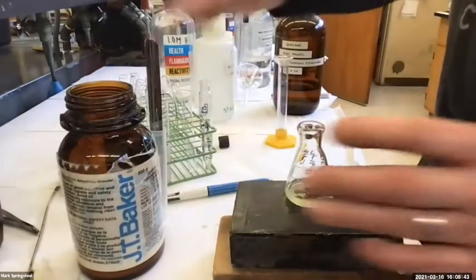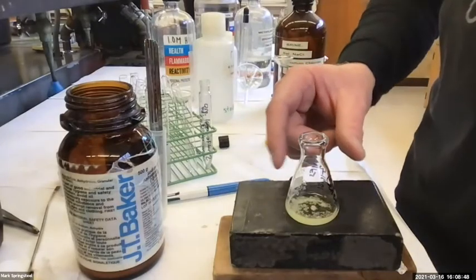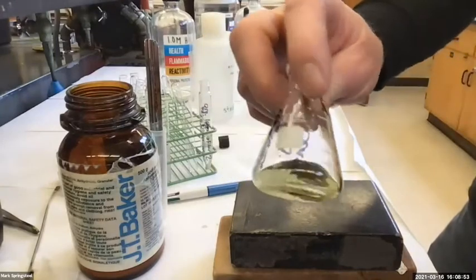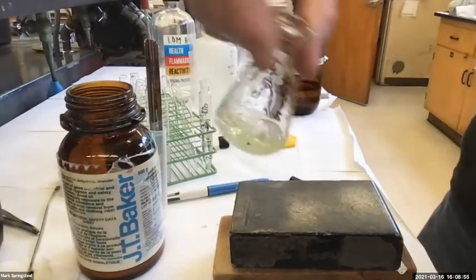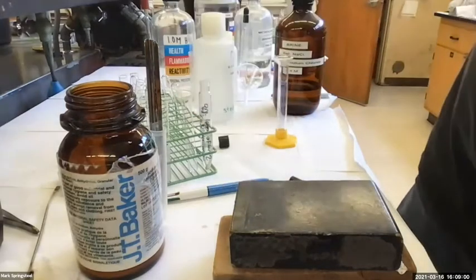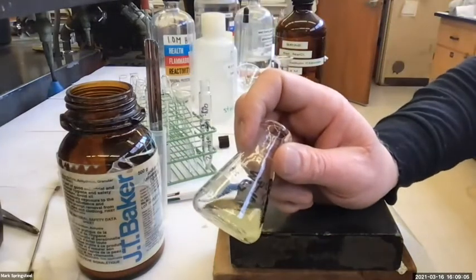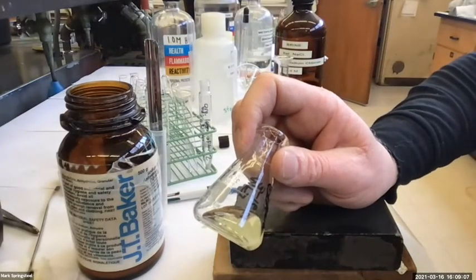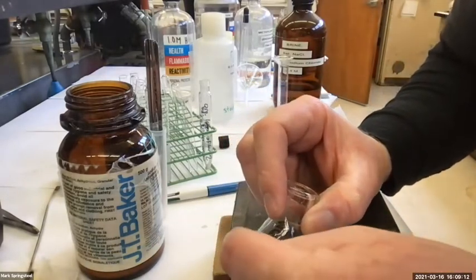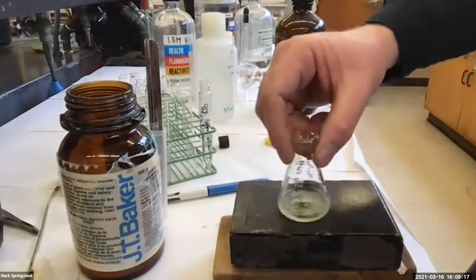This comes with experience. You just get the eye for it. Normally when you're in lab, the first few extractions you do, everybody comes up asking, is that enough? Is that enough? And then after a while, they're like, okay, now I got it. They get comfortable with it. One of the main things I can see is the organic layer got much clearer. It looks nice and clear. And often you'll see little beads of water stuck to the inside of the glass, and now there's no longer any water stuck to the inside of the glass.